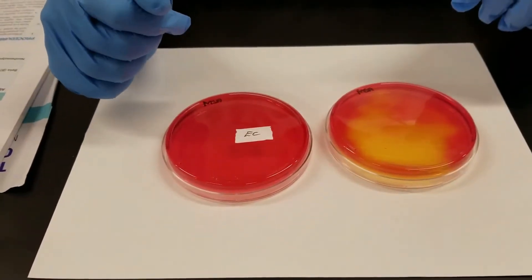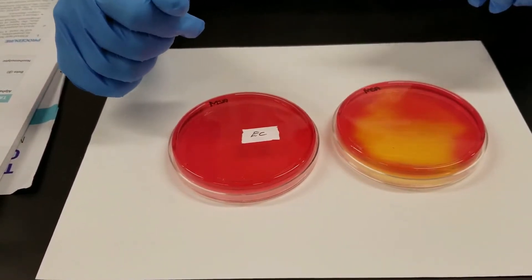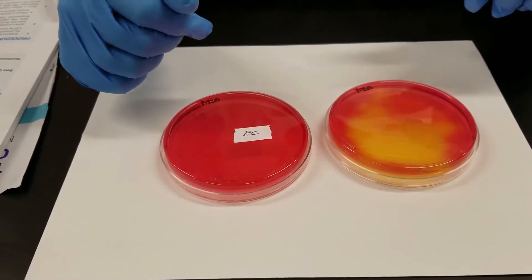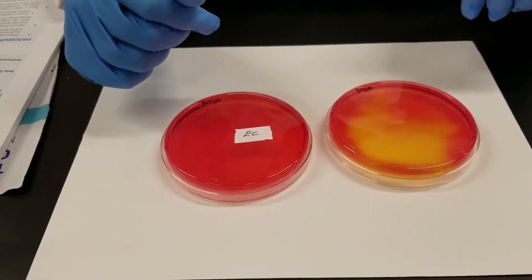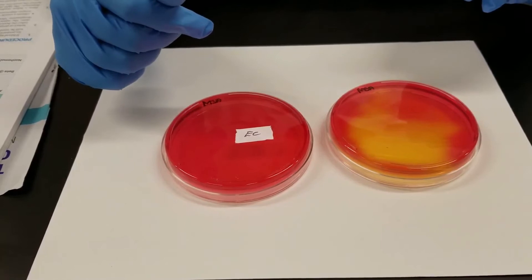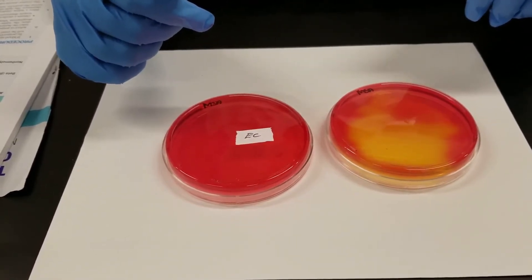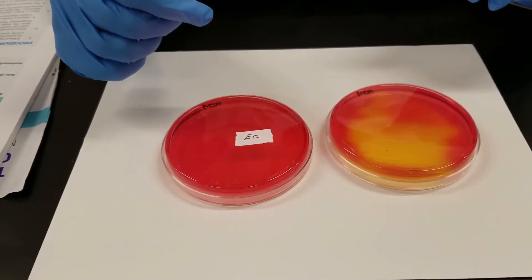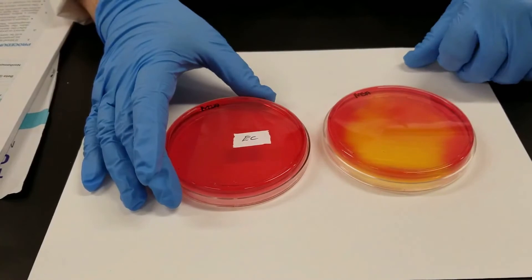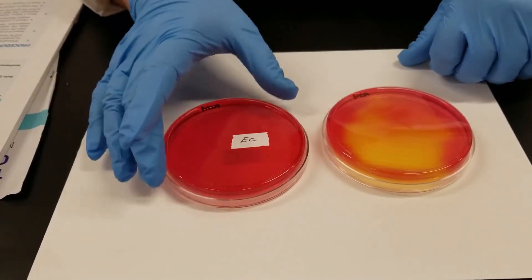This is the MSA, mannitol salts agar. This is both a selective and a differential media. It is selective from the standpoint it has a higher salt concentration than most media. Staphylococcus is a species that can tolerate high salt concentrations — most other organisms cannot. As well as some of the dyes that are in there will inhibit the gram-negative.